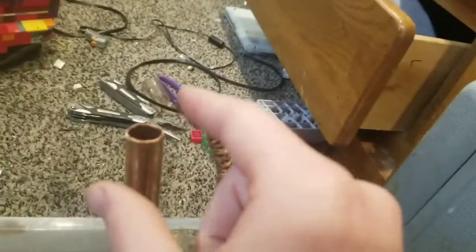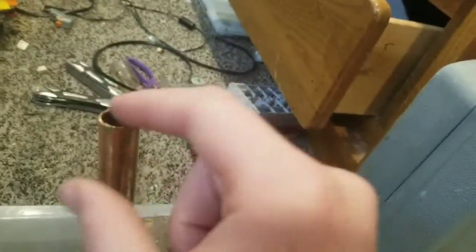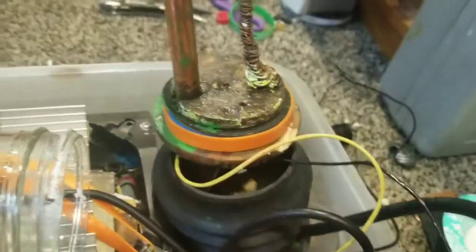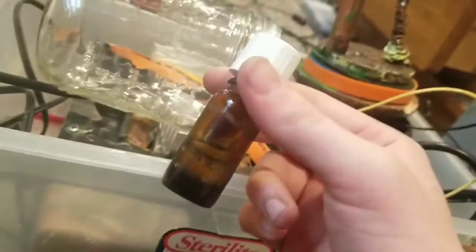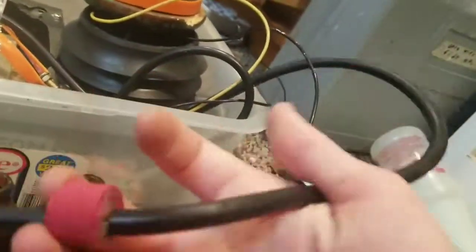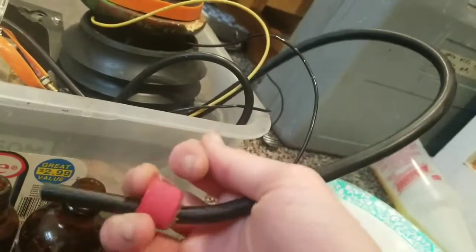The air goes up and it gets ionized by the high voltage, and then it gets sucked down and it gets bubbled through a container. This is the container that I am going to do the test run with, since it's nice and small, but eventually after I get it up and running I can move to bigger containers. They all have the same size cap, so I won't really have to modify this setup. I can just press this further back so that I can fit bigger bottles.